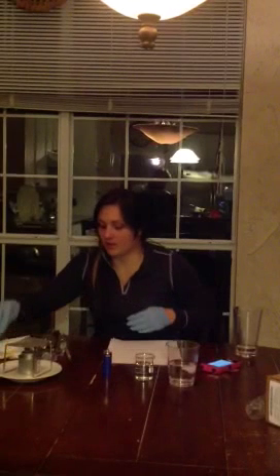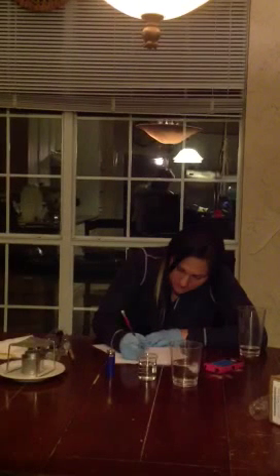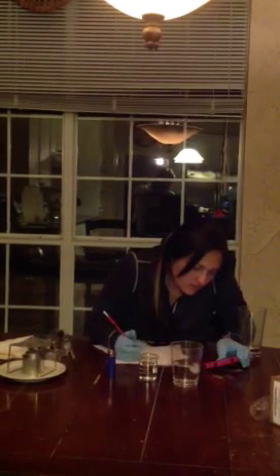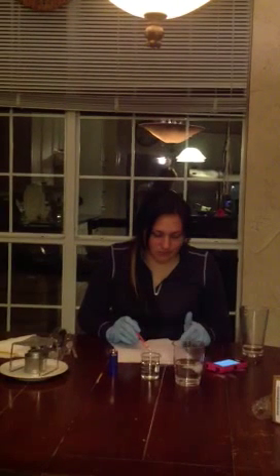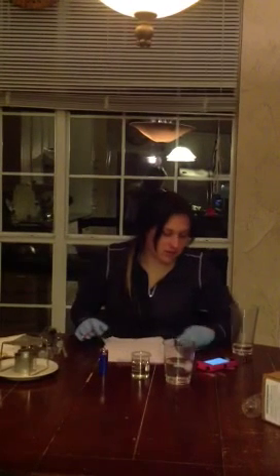So we need to record our findings. I'm going to place this on paper so that it doesn't break. And after we have gathered all the data for the hot tap water, boiling water, cold tap water, ice water, etc., we're going to convert them from Celsius to Fahrenheit, and then Fahrenheit to Kelvin. So 30.1 degrees Celsius will be calculated to whatever the equivalent is in Fahrenheit and whatever it is in Kelvin.